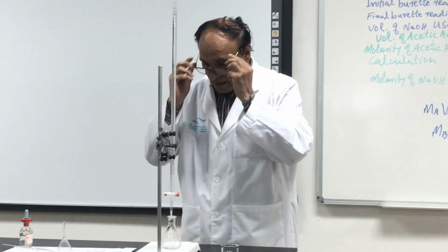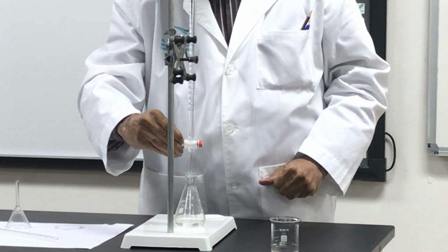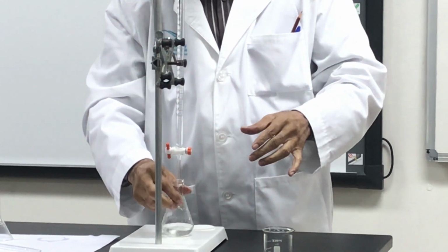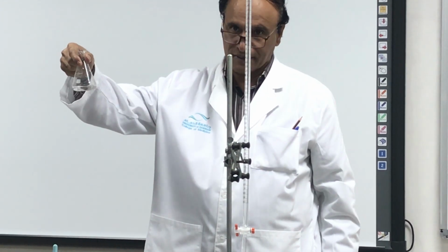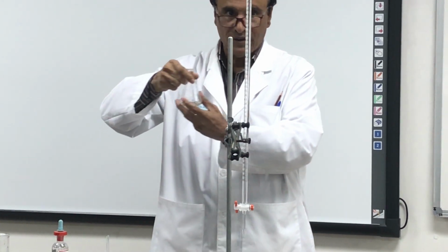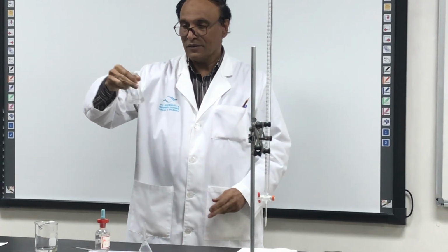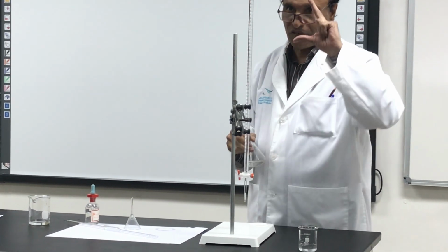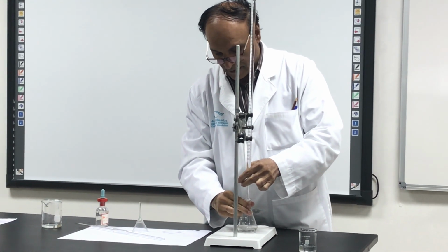And now I will add this into this one. When I add this into this one, I tell you the best way, hold it with 3 fingers, like this, 3 fingers. Don't hold like that, it is not right. Hold with the 3 fingers from the neck and move it like this. Swirl it, okay? You can do it like that, swirl. And this one hold with the 3 fingers, and you add what into this one.